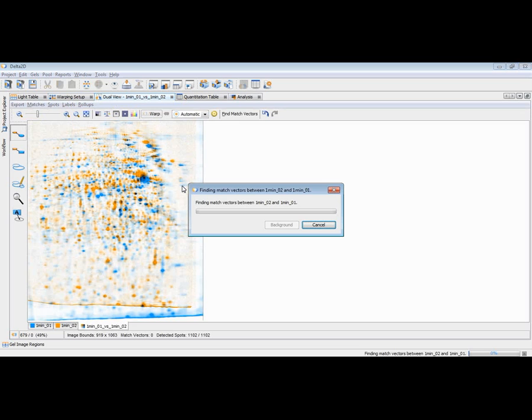I just press the warp button, and then Delta2D is analyzing the images. The complete image is taken into consideration, and then match vectors connecting similar areas on both images will be found. We will soon have a look at the result. This is image processing. It takes a second depending upon the power of your processor and the memory, of course, which is available in your machine. So this is almost ready.